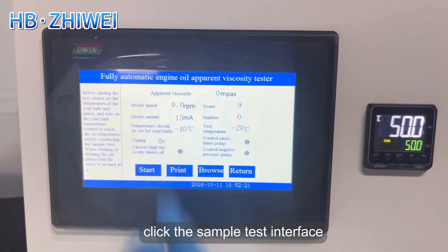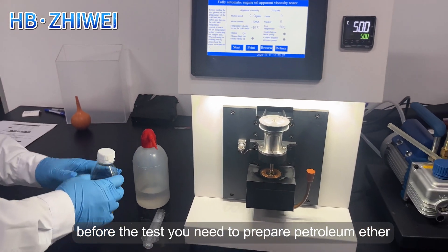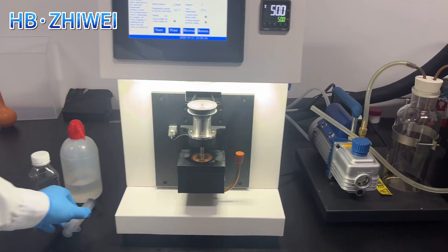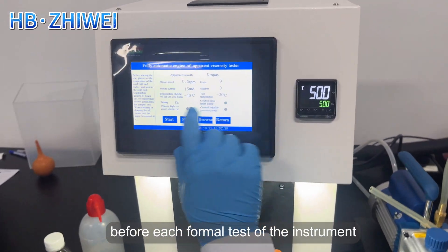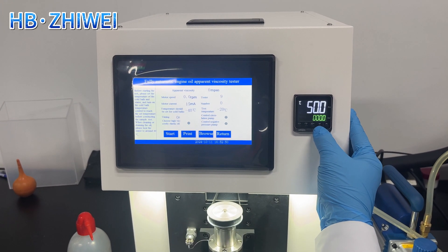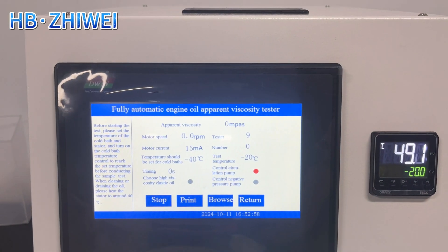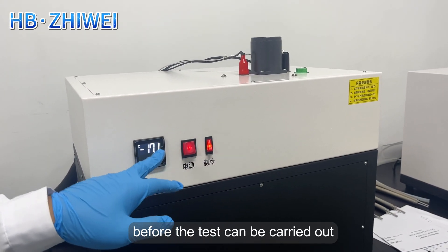Click the sample test interface. Before the test, you need to prepare petroleum ether, the oil to be tested, and the syringe. Before each formal test, a hot engine test must be carried out. The temperature of the hot engine test can be set based on the temperature of the oil sample to be tested. Here we set the host temperature to minus 20 degrees Celsius and press the start button. Wait until the actual temperature of the refrigerator drops to minus 40 degrees Celsius before the test can be carried out.